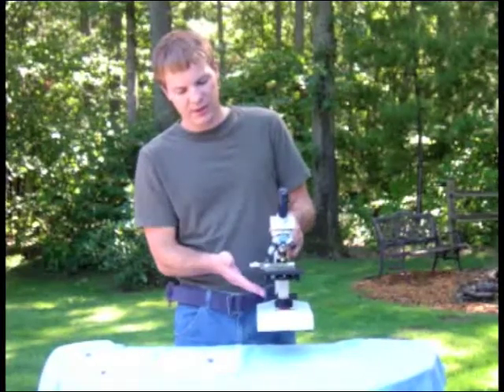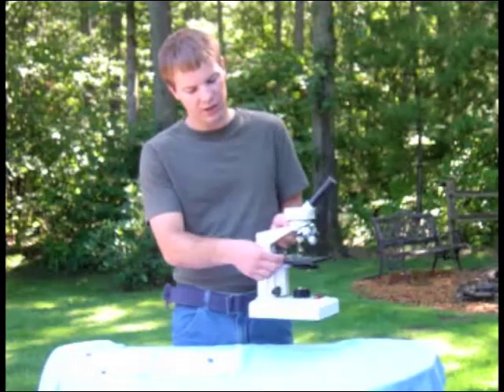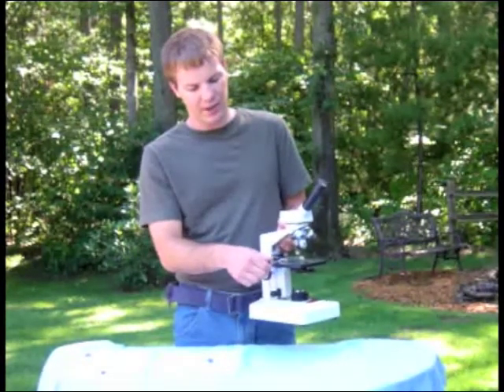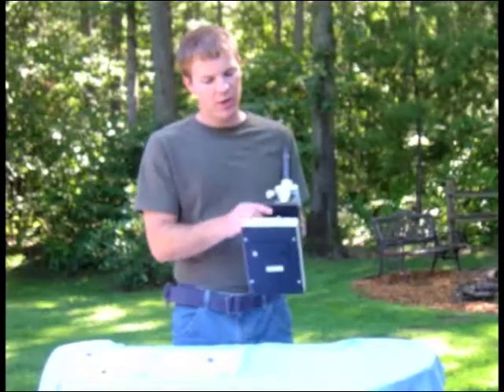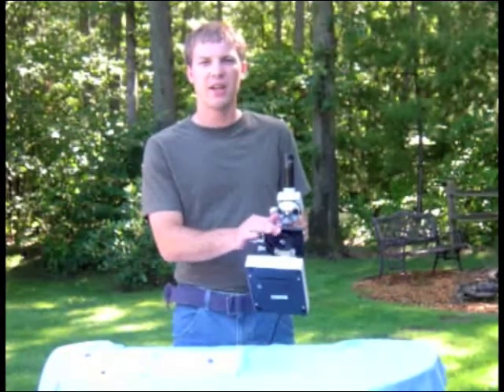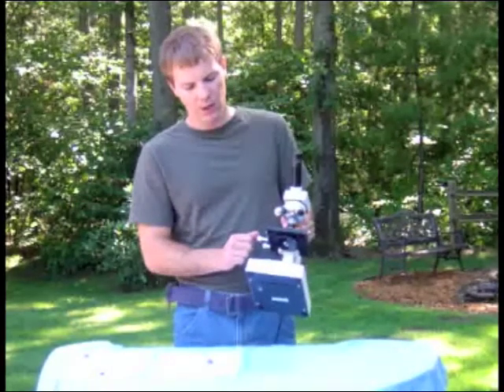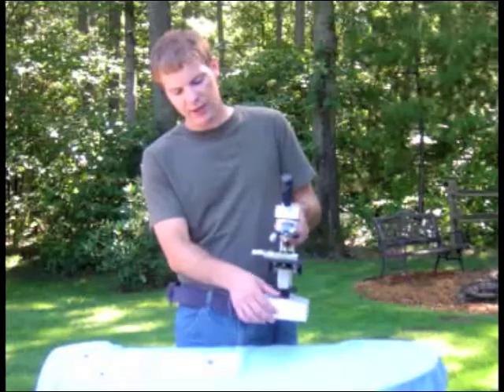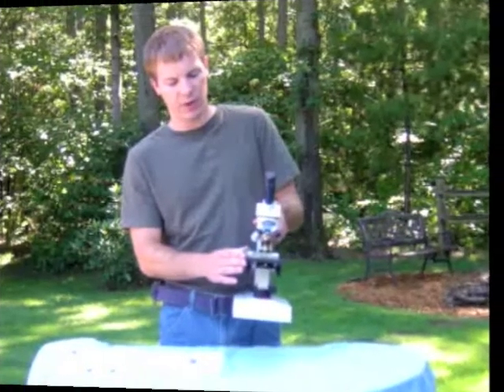Below the objective lenses is the stage, where you'll be putting your slides and specimens. The stage is controlled by two knobs that move your slide up and down and back and forth. Underneath the stage is something called the diaphragm — it's a plastic disc with different sized holes that lets different amounts of light in, and we'll talk more about that in a bit. At the base underneath the stage you'll see a light with an on/off switch. So those are the basic parts of the microscope.